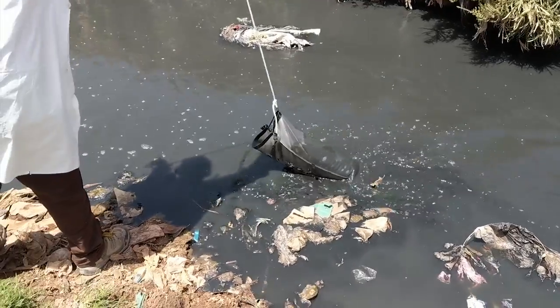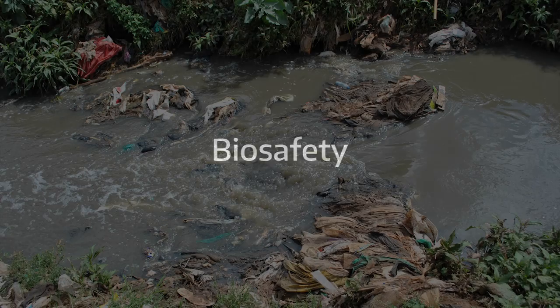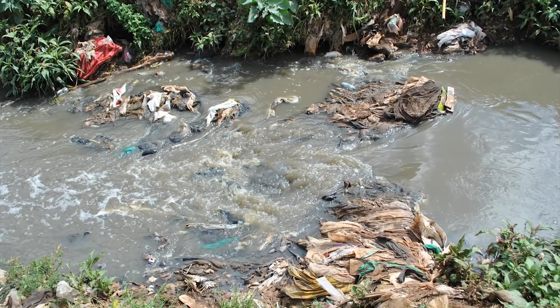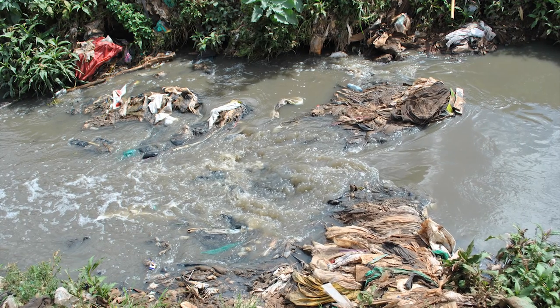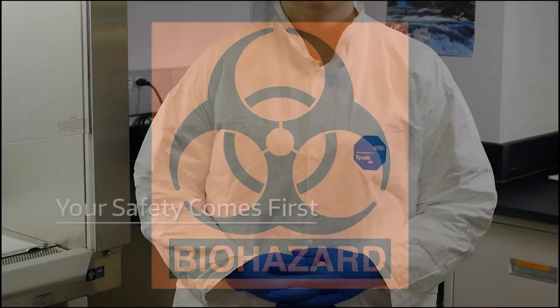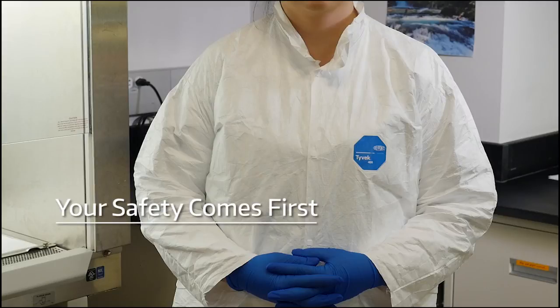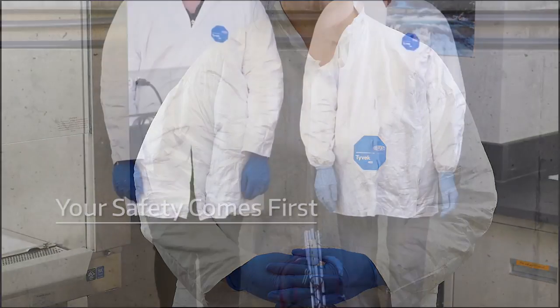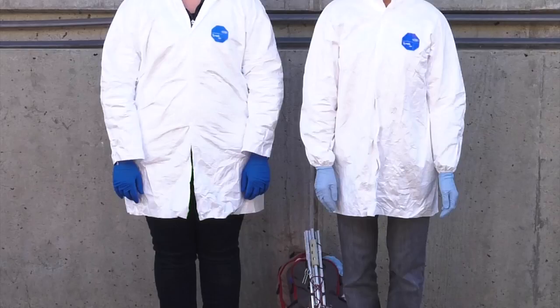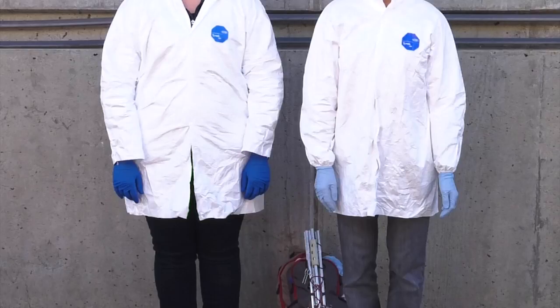This video will walk you through the BMFS field protocols. Before we start, it's important to remember that working with wastewater or potentially contaminated water presents a biosafety hazard. Your safety, and that of your team, comes first. Please use personal protective equipment at all times, including a lab coat, gloves, and a face mask.